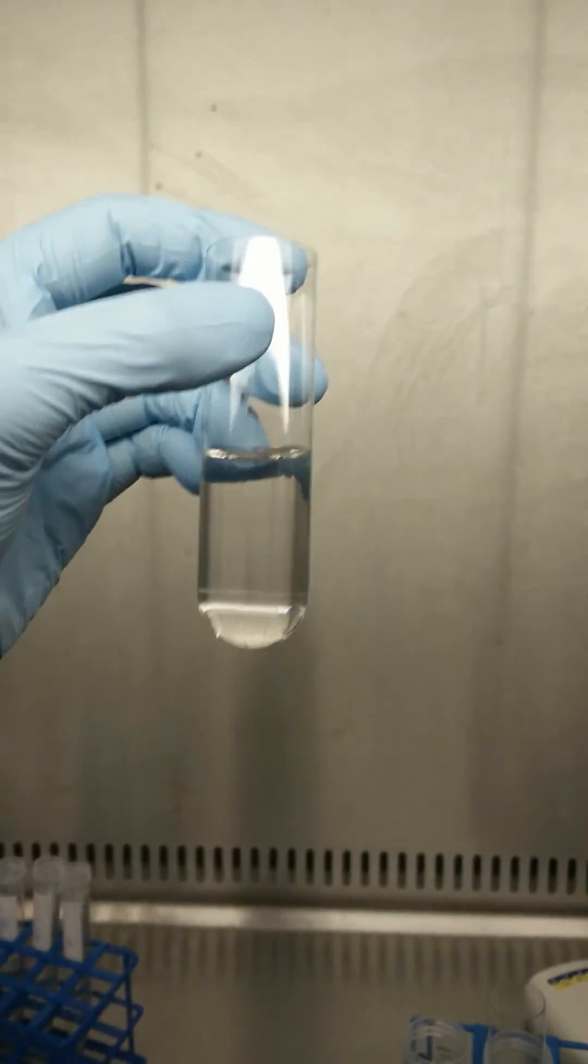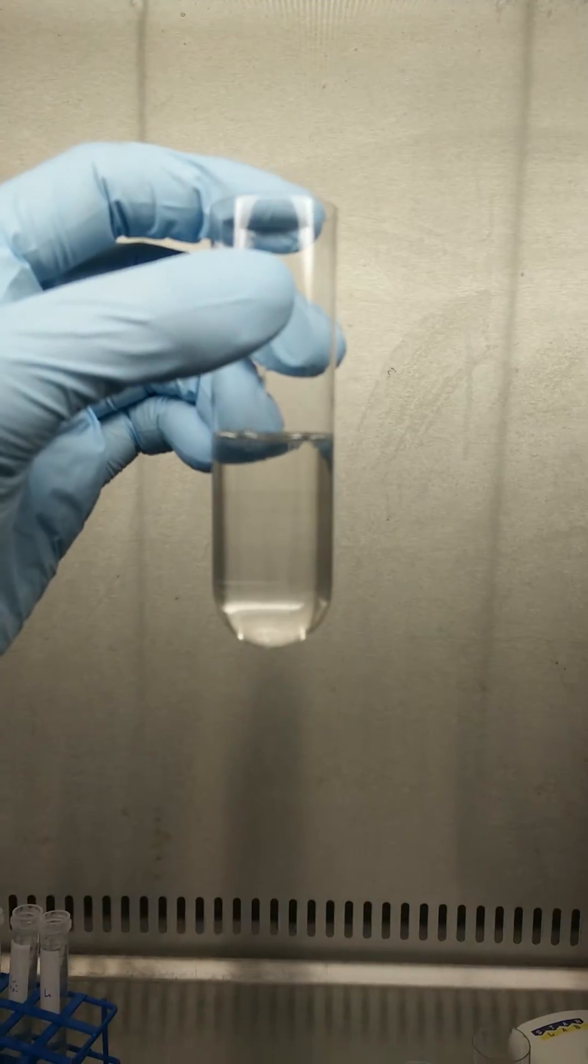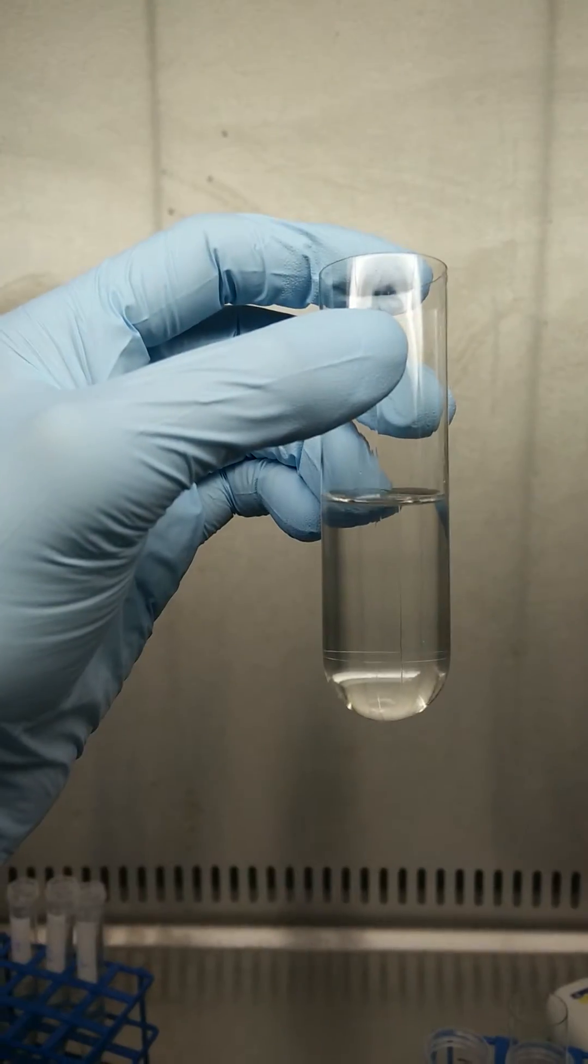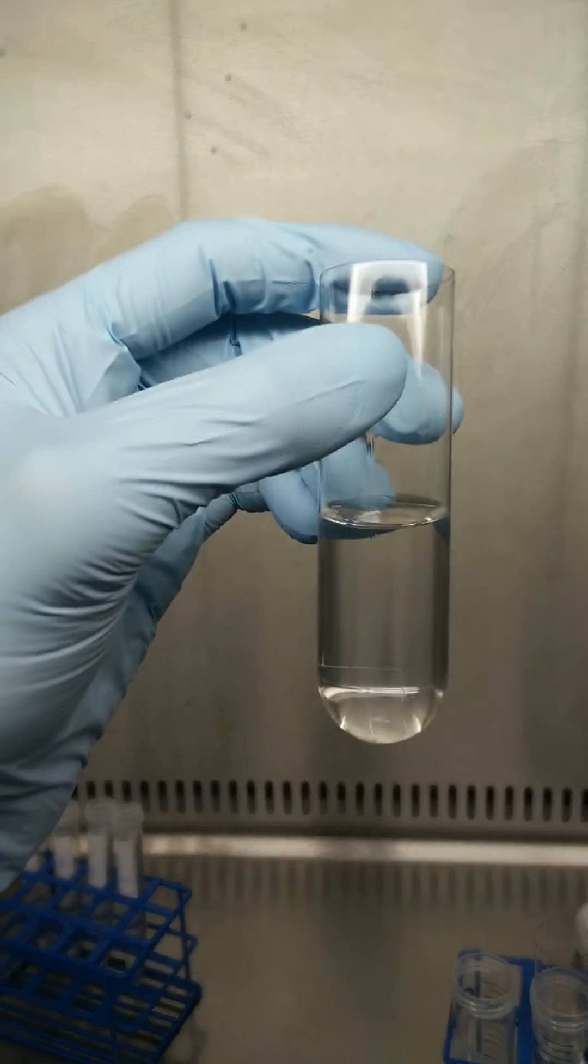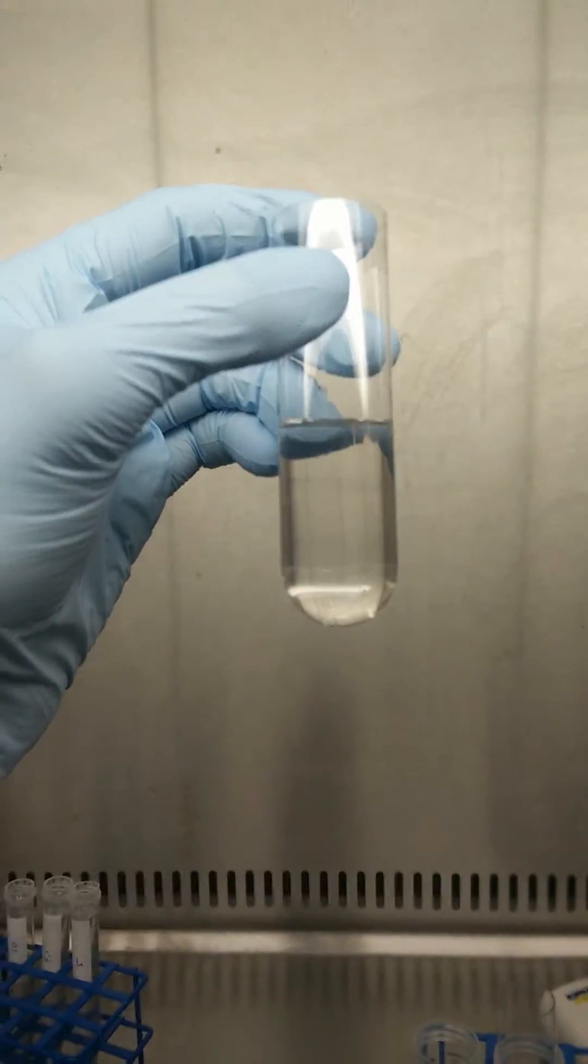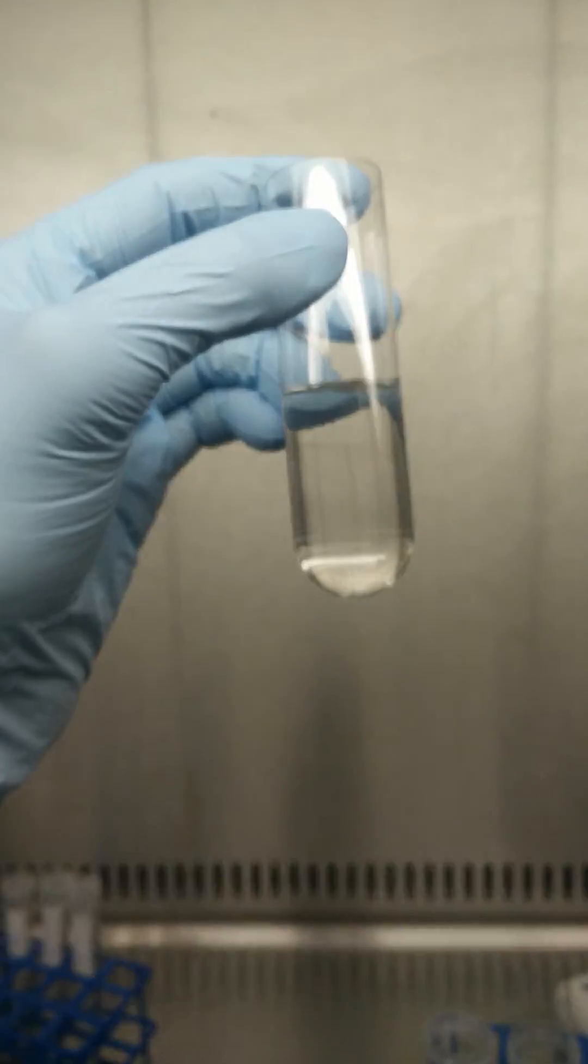So now three layers are in this tube, and if I swing it a bit you should be able to see the borders between these layers. See?